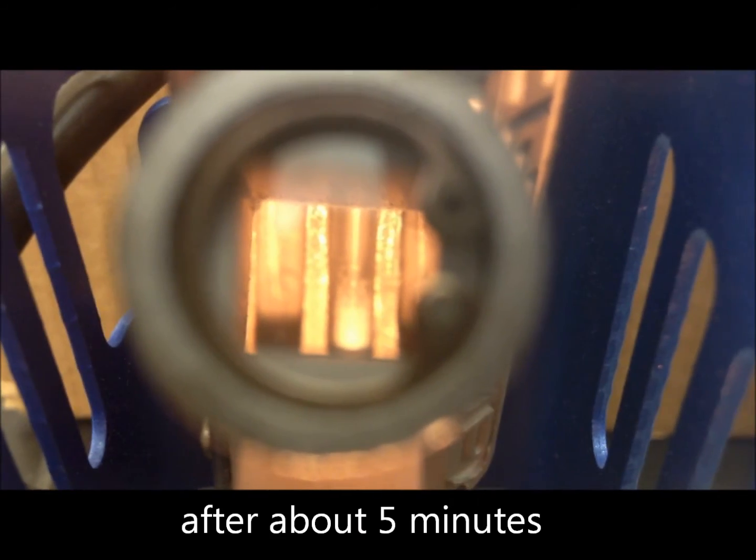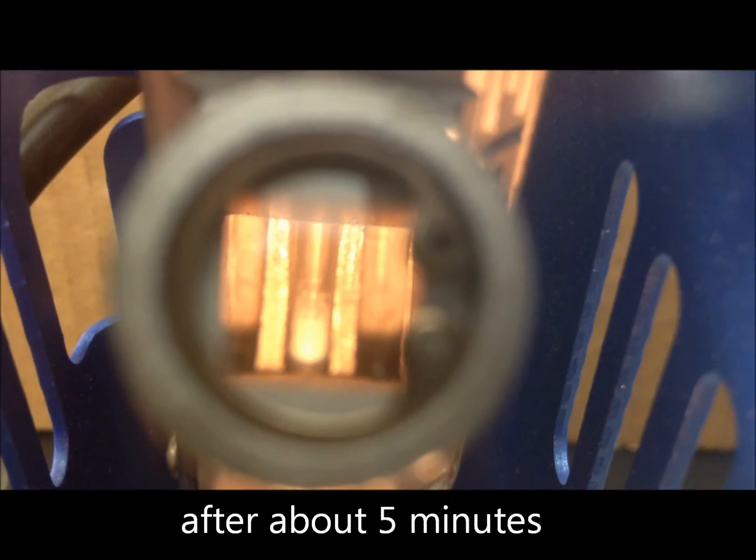Alright, now our sample is approximately 10 degrees Celsius below its literature melting point value. So we're going to lower the apparatus to level 2.